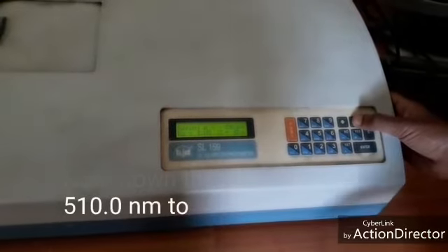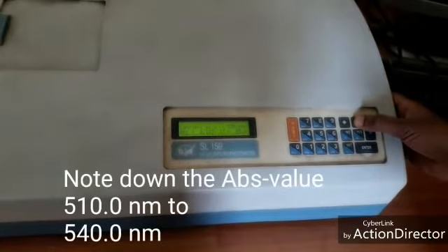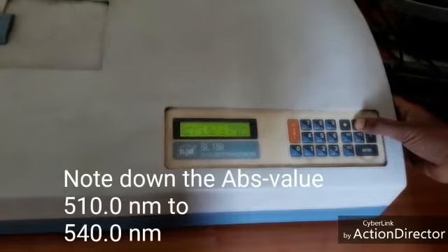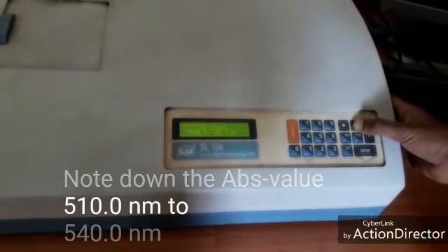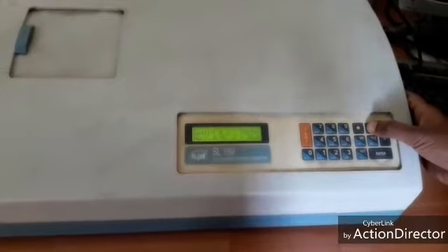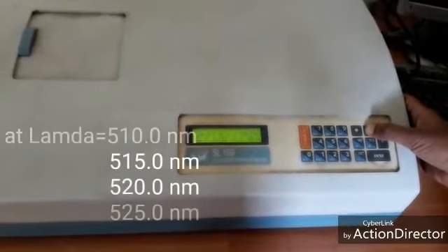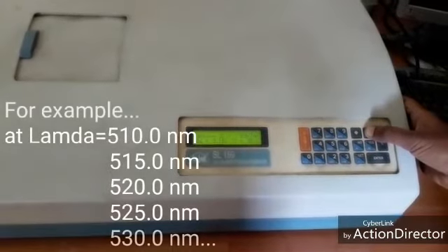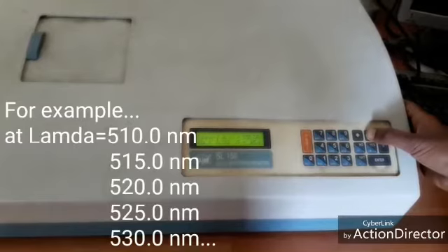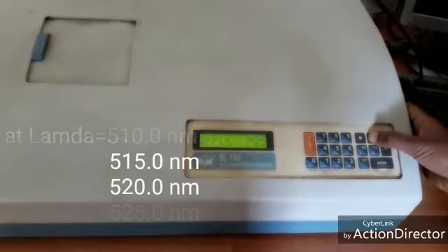Note down the absorbance values from 510 to 540. For example, note down the values at 510, 515, 520, 525, 530, like that. Note down the absorbance values.